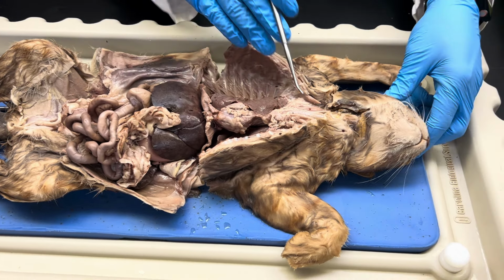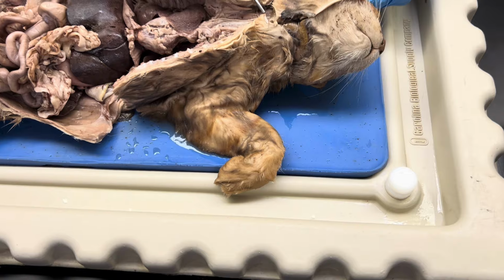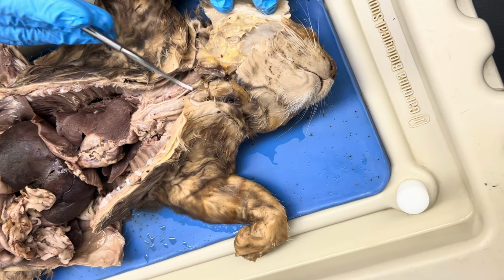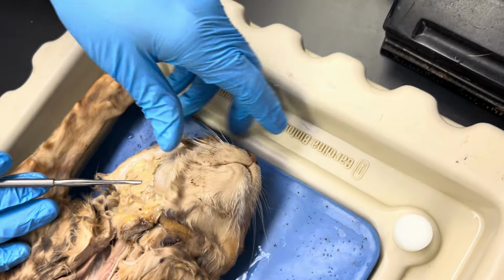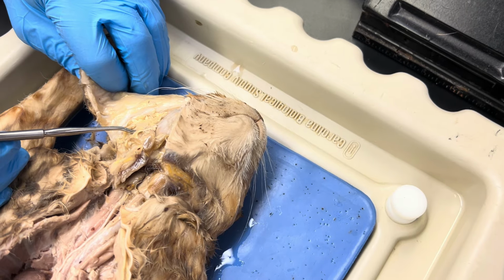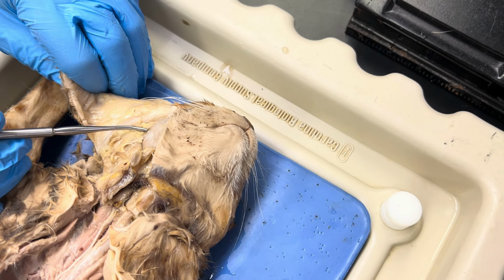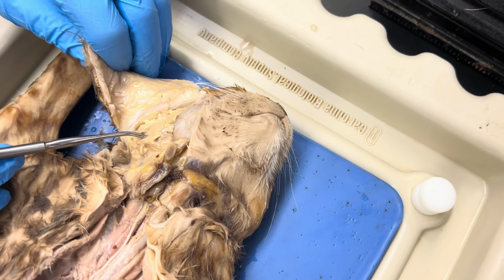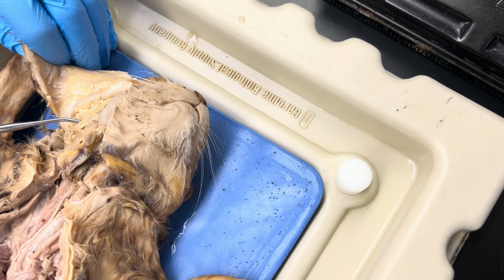Remember we just talked about the parotid salivary gland in our little discussion? So if you look, here's the ear right here, right? In a human, the parotid salivary gland was just anterior to the ear. So we cut a little flap, and you see this kind of, it almost looks grainy right here. See the location of it? There's the ear, here. See the location right here? That's the parotid salivary gland in the cat. Same location, just anterior to the ear. It kind of looks like it's on the side of the head, which it is, but parotid salivary gland kind of looks like a pork chop almost. It's kind of grainy, it's whitish in color right here.